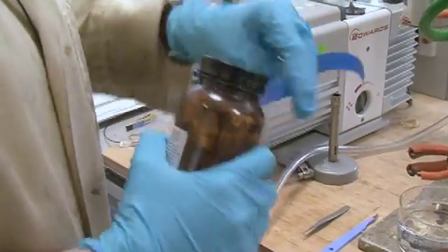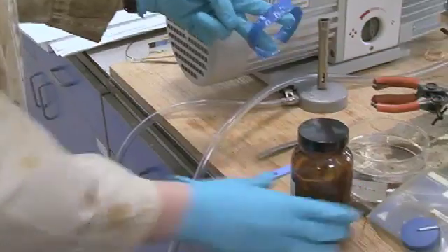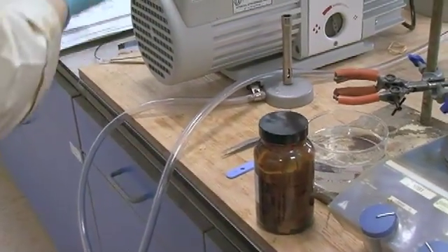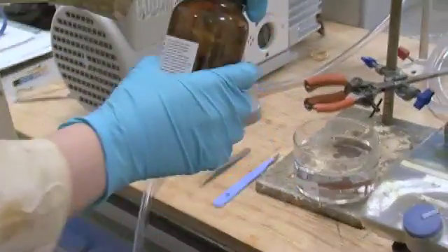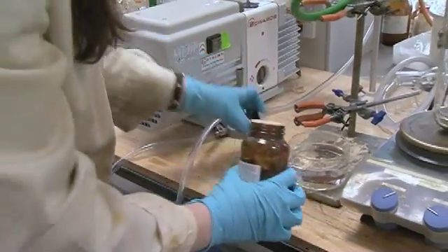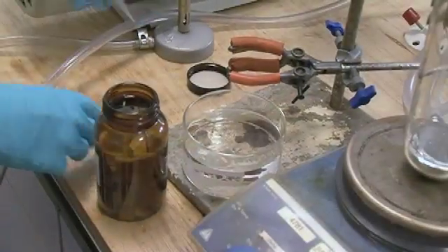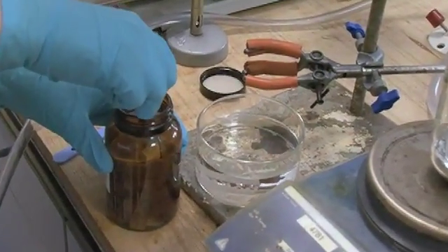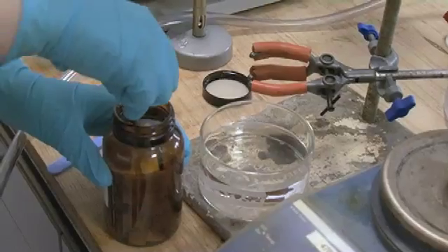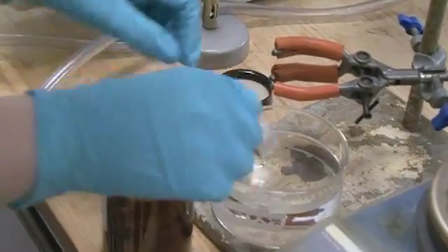So sodium's pretty soft, so we can cut it up with a scalpel, which we've got here. So just get a pair of tweezers. Let's get some sort of chunk like that.